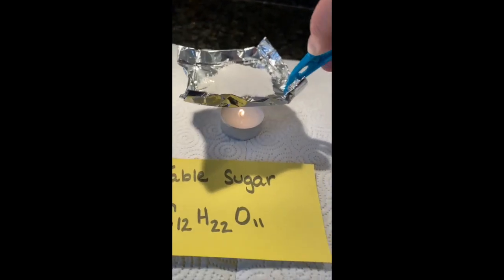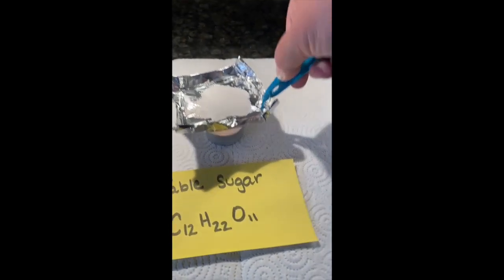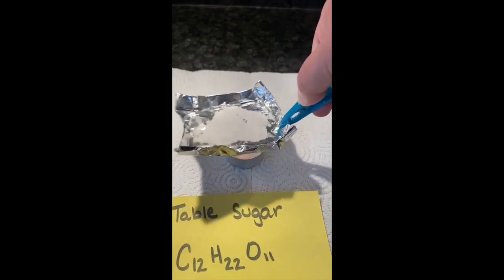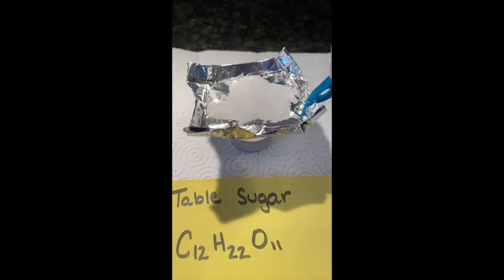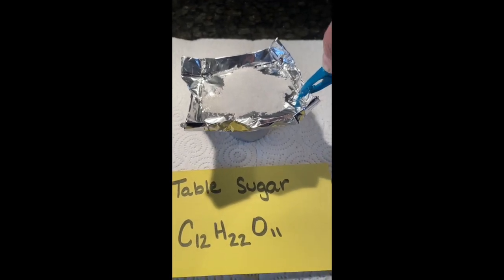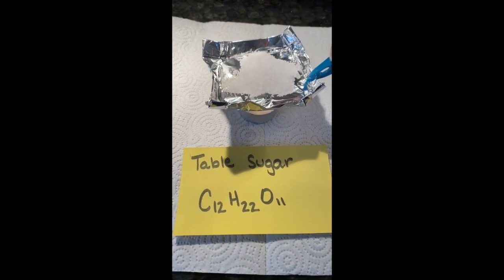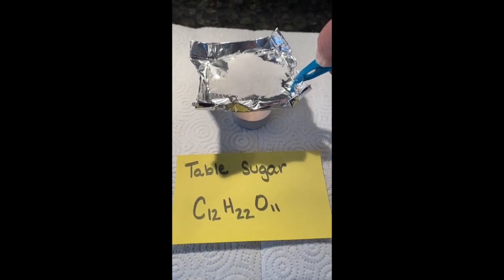Remember that before the reaction happens, you should be able to explain what you're seeing. So obviously we have a little fire. And our sugar, you guys have seen table sugar before, just a white crystal solid there. So we'll heat this up, and I do think I'm gonna have to pause and come back to this. This might be a minute. So I think I'll do that, and then I will stitch the 2 halves together. So I'm gonna let this do its thing, and then you'll see what's happening in a second here.